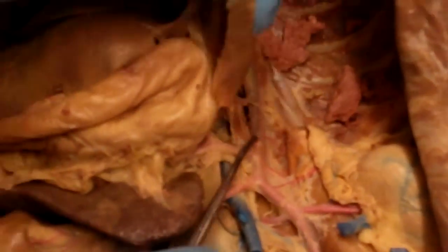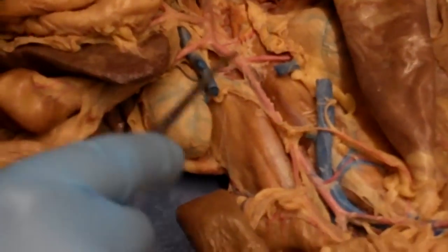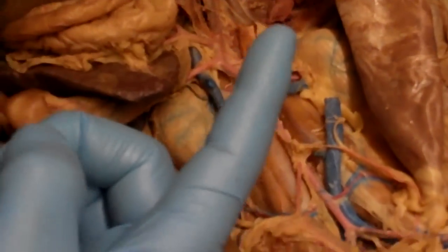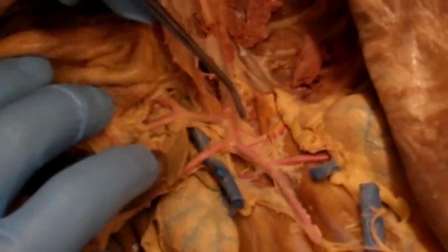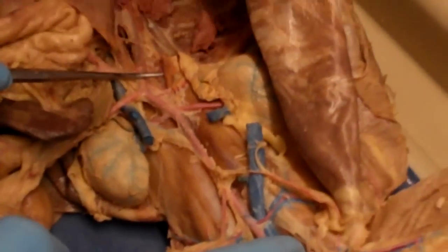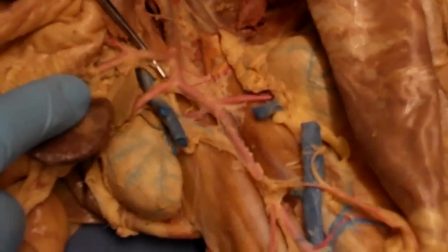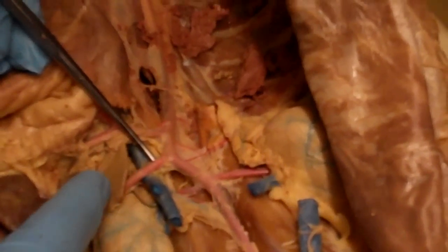As soon as we cross the diaphragm and get into the abdominal aorta, then we start to see a lot more branching. Three of the branches are going to be unpaired, meaning that there's just one vessel for each. And you can see two right next to each other. Well, this whole structure is the abdominal aorta. Okay. The first branch off the abdominal aorta is going to be the celiac artery. And then right next door to it is going to be the superior or the cranial mesenteric artery.